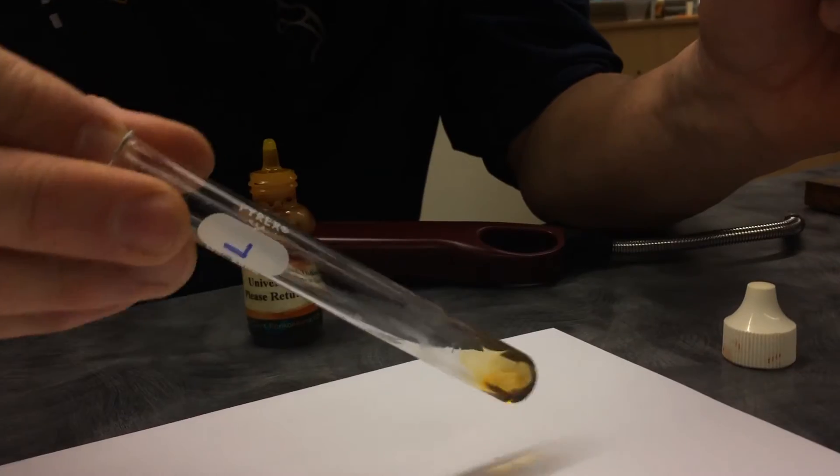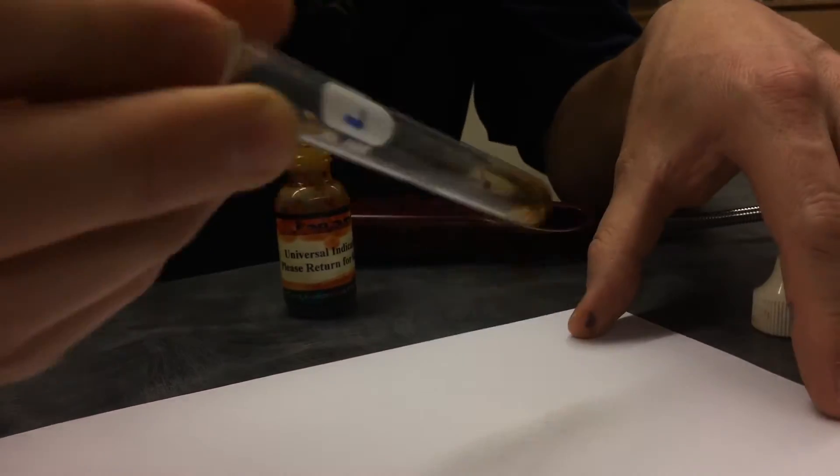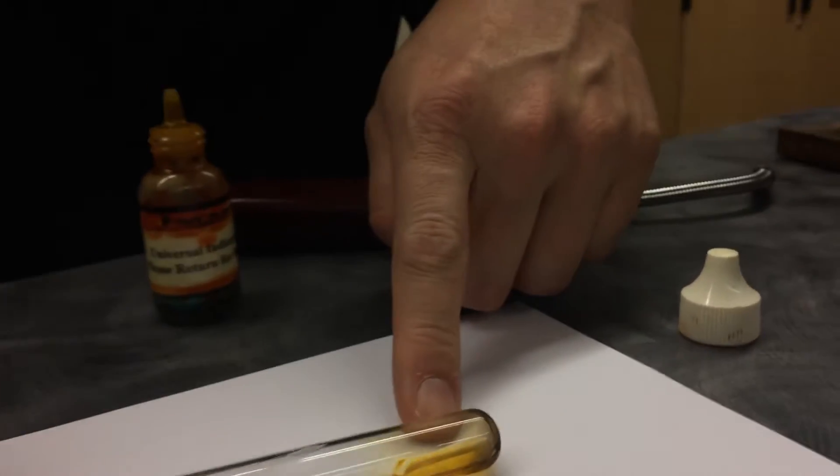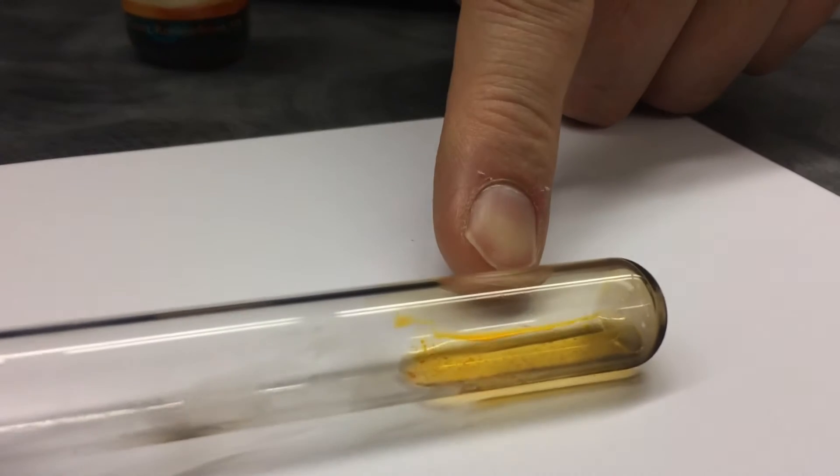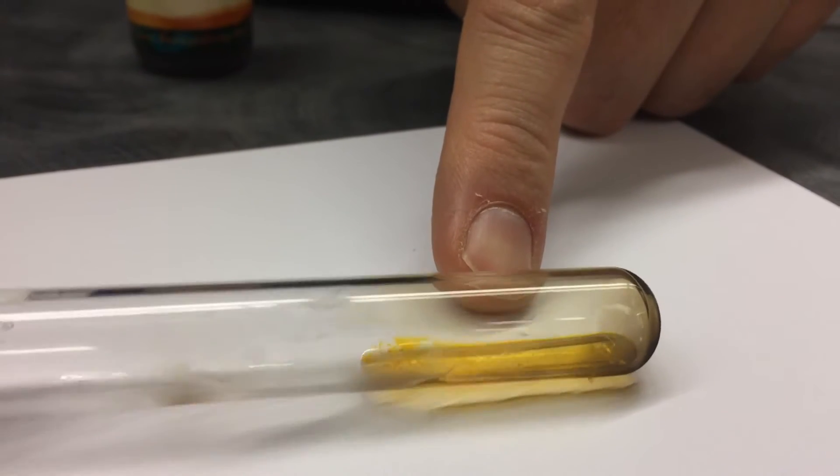Okay, let's... Oh, nice. I like that. Now, because it is lard, it's kind of a fatty thing. But you can see, you have to kind of look right in there, but you can see that the universal indicator is definitely orange. Oh, that's pretty awesome.